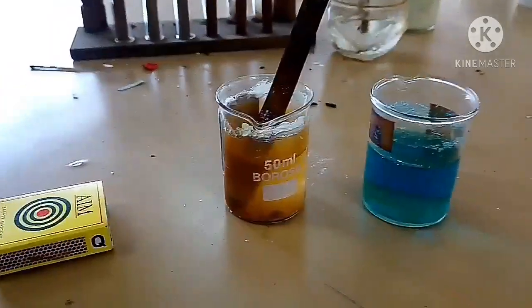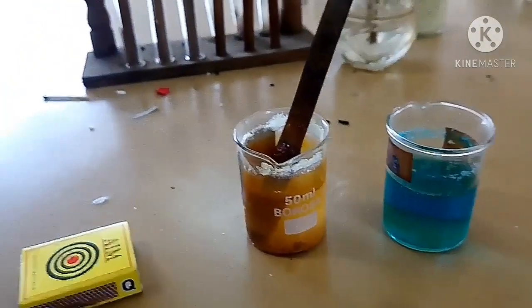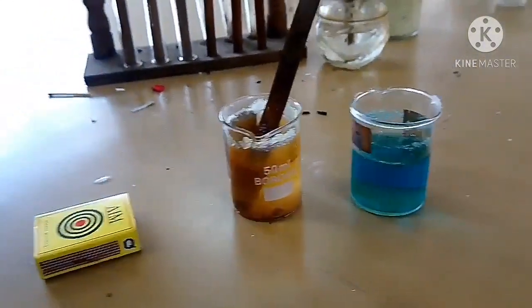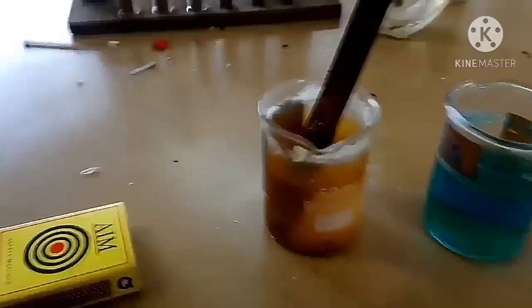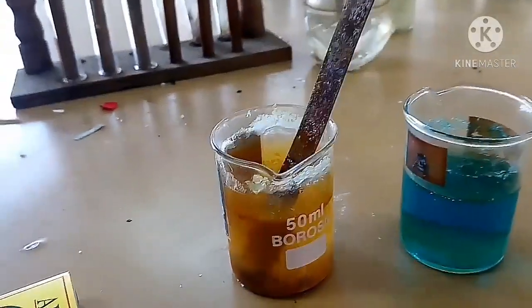You can see the blue color of the copper sulphate solution has turned to grey or brownish color after the reaction, and the iron strip also changes its color. You can see there is a coating on the iron strip.